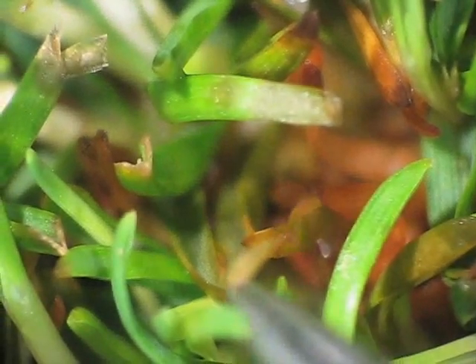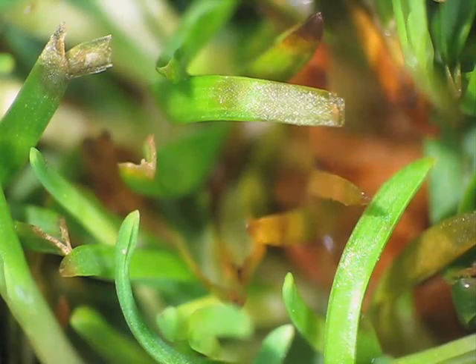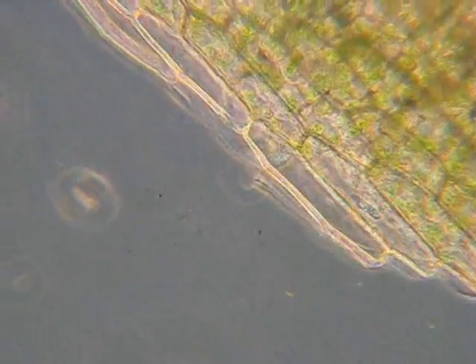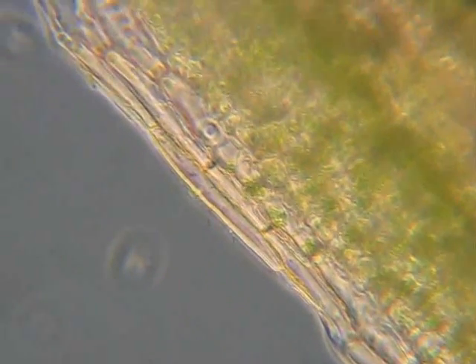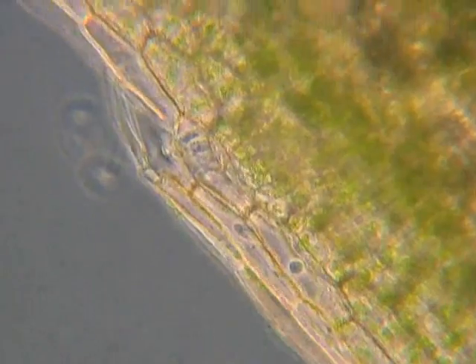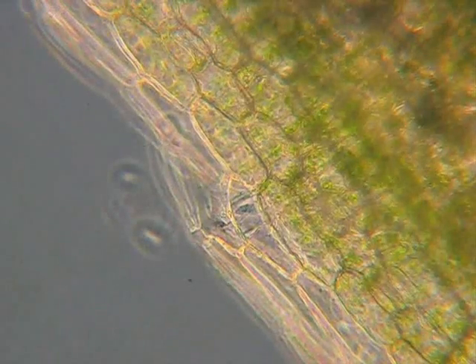From here, take that slide and put it onto a compound microscope, where we'll see something that looks like this. Those two little cells that just went by, and this one at the bottom, are the spindle-shaped cells of Labyrinthula terrestris. To confirm the organism is actually in the plant, look at the edge of the cells where it's been ripped apart, focusing up and down, and you'll see some of these cells inside the tissues — oblong-shaped, right inside the cell layer.